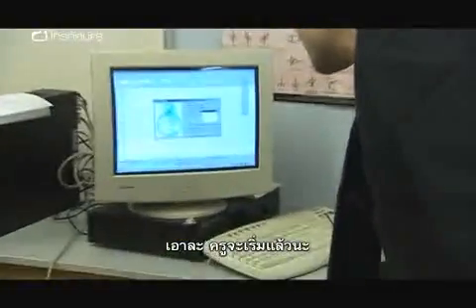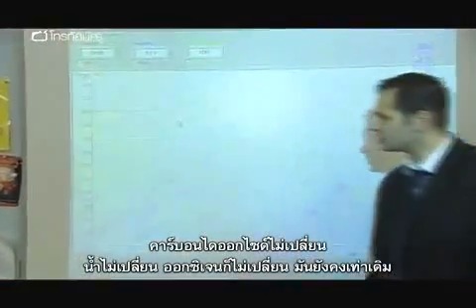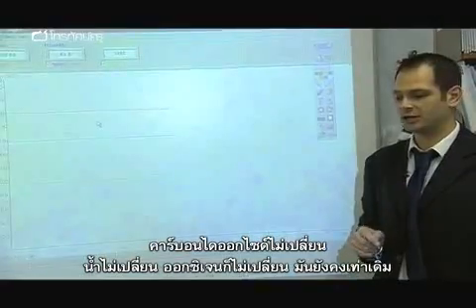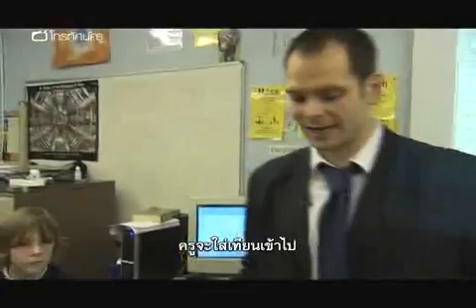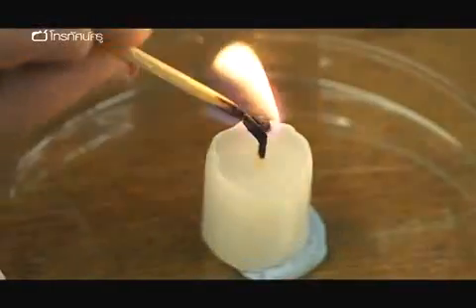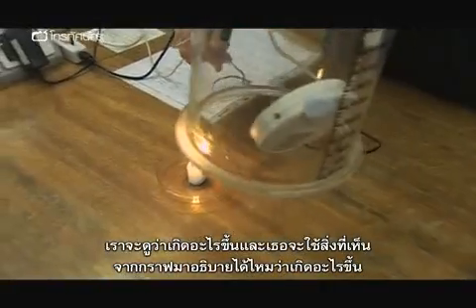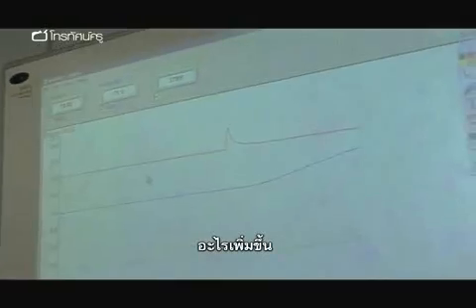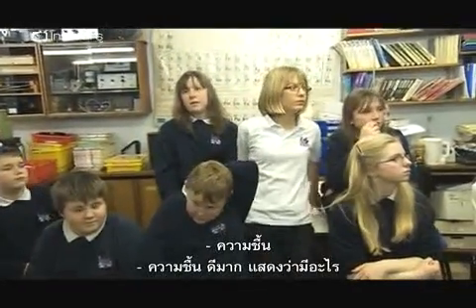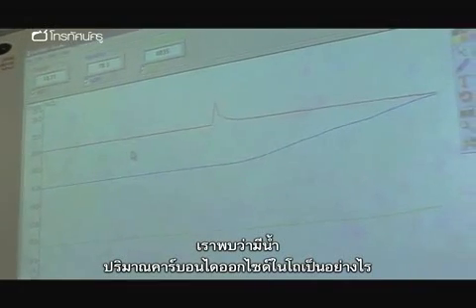Okay, here we go. I'm going to start it playing. So our carbon dioxide is not changing, our water is not changing, and neither is our oxygen. Okay, staying the same. So I'm going to put the candle in. I'm going to watch what's happened and see if you can use very quickly the ideas of what happens with the graph to explain what is going on. Okay? So what's rising? The blue. Moana? The humidity. Good. What's that detecting? The water. Thank you, Cameron. Okay. So we are detecting water.